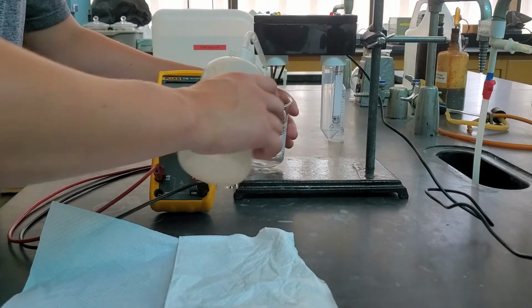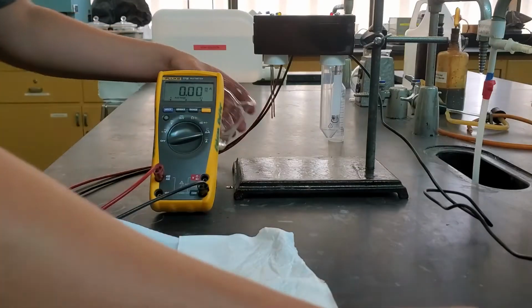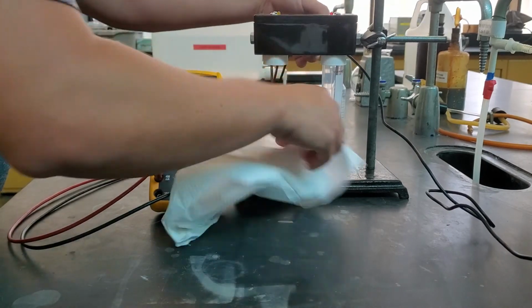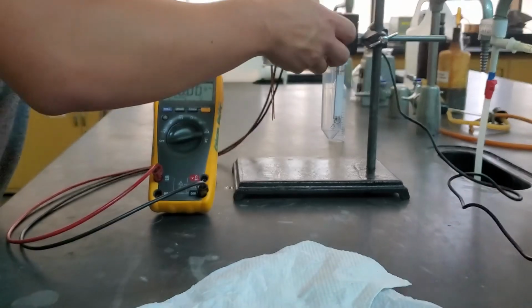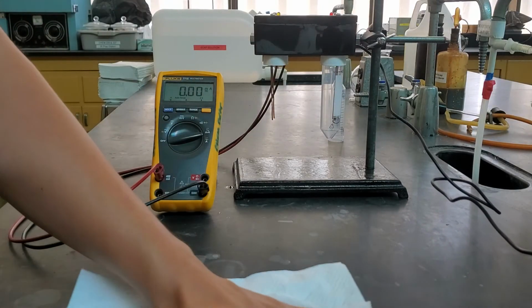We're going to see if it's only covalent compounds, the sucrose, which is all covalently bonded, or if it might be all solid compounds. Plug this back in. And so we're going to do a similar test.